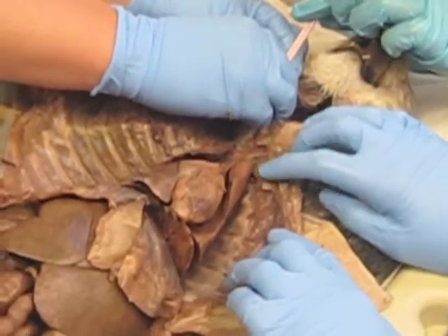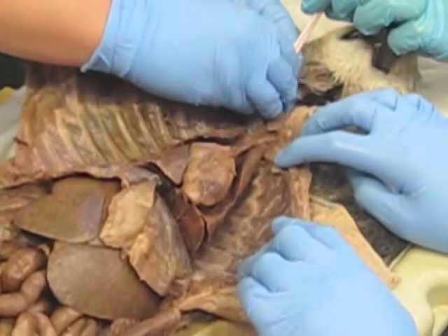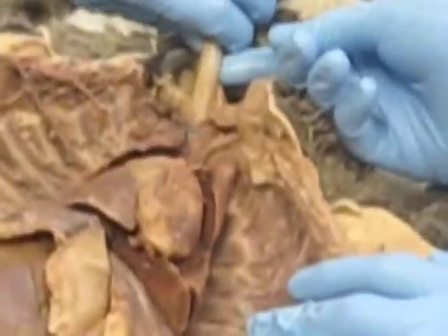And you can see — relax. Take a nice deep breath and relax. And there you have it. All the air is going in.